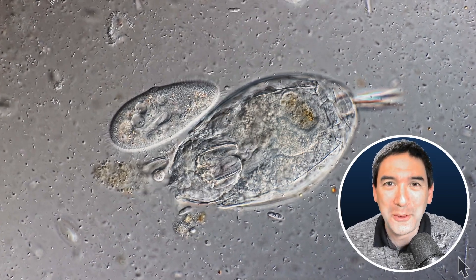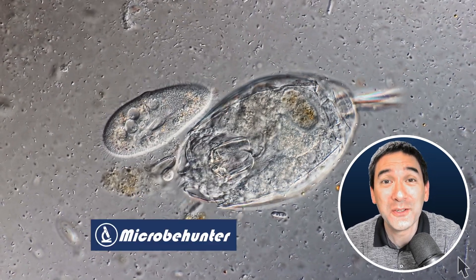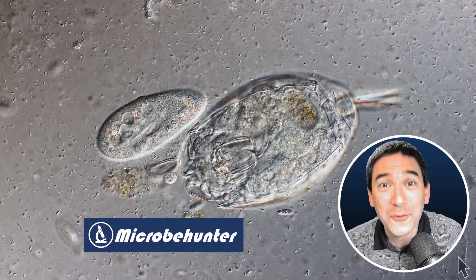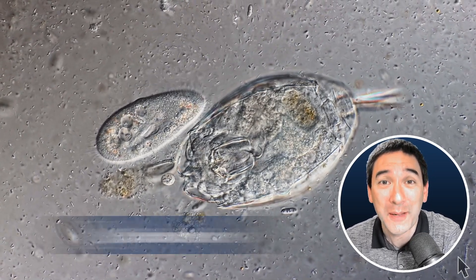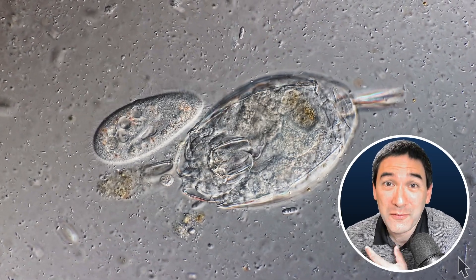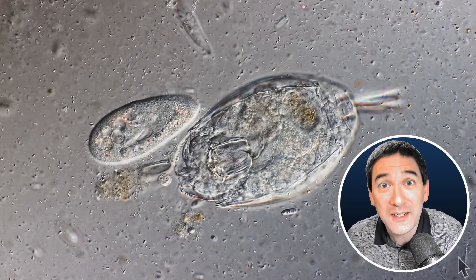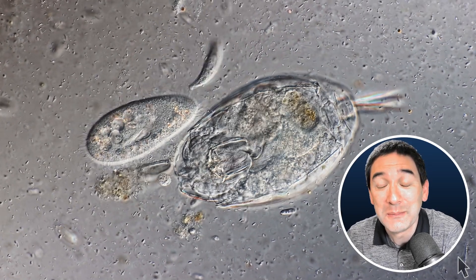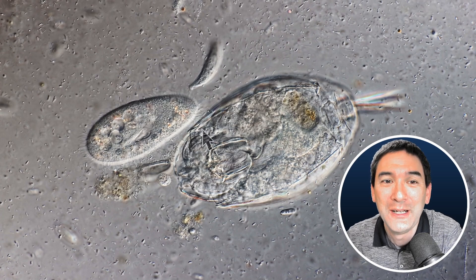Hello and welcome. MicrobeHunter here, and today in this video I'd like to answer the question of why it is sometimes so difficult to see individual cells under the microscope. Over here I want to give you an example. I did pre-record this on a video because it makes it a little bit easier for me to move my little arrow around here.